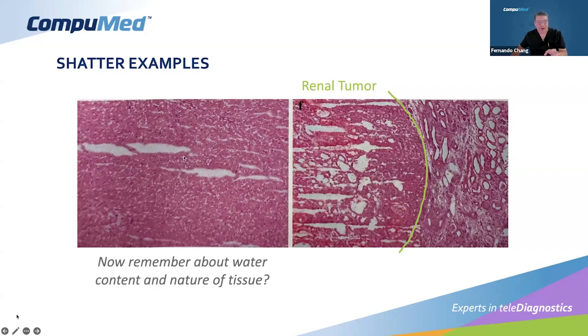So the shatter is happening here, and in this picture to the left, assuming it's a higher power, you can see it's happening because of the water content. Tumors, renal tumors and cancers in general, have a lot of apoptosis, a lot of necrosis, and inflammatory processes going on. Cancer cells just don't behave the way regular normal cells in this individual do. So there's also an increase in circulation and local edema. So the water content in general is higher than in the normal kidney, although this kidney is filtrating urine, but if we cut at the right temperature, we won't have the shattering.